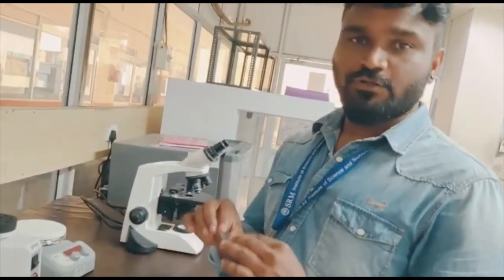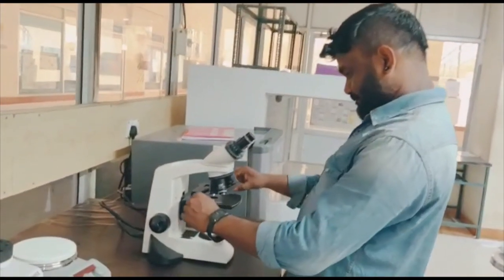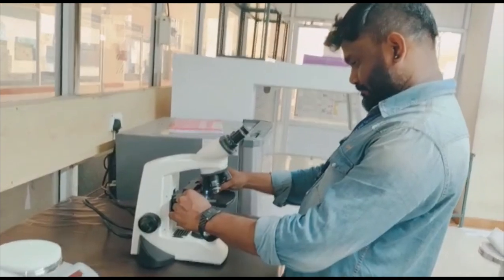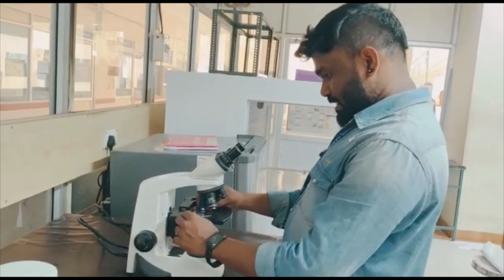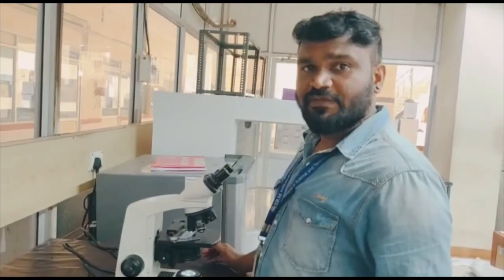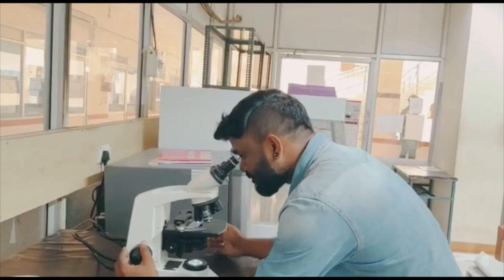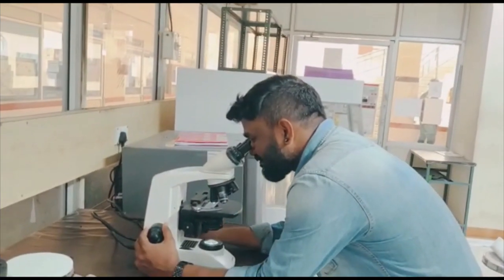Let's look at the slide under the microscope. Always go from the lower magnification to higher magnification.